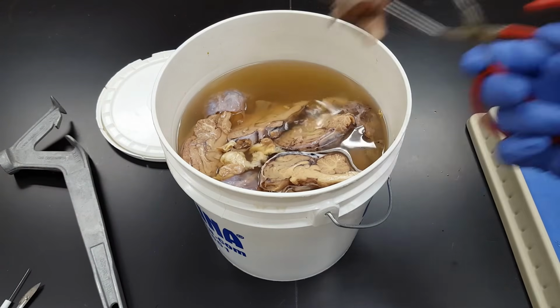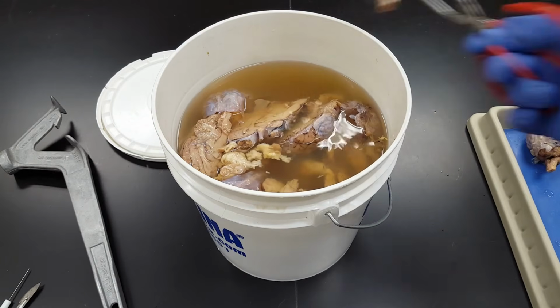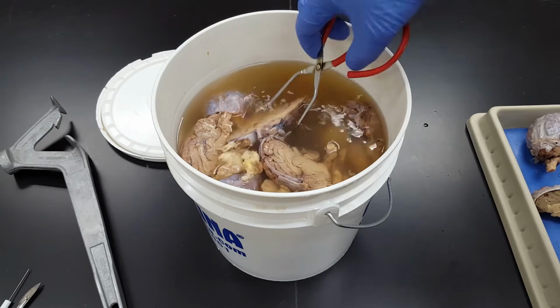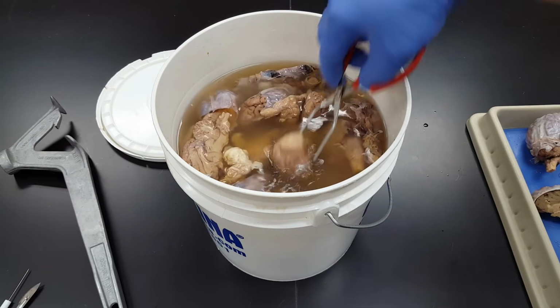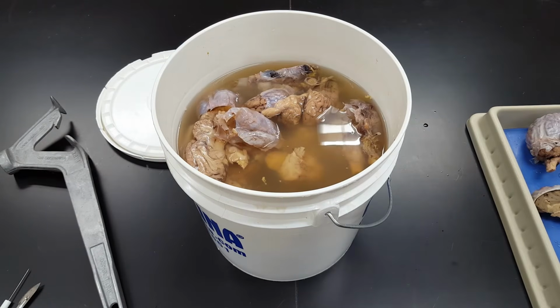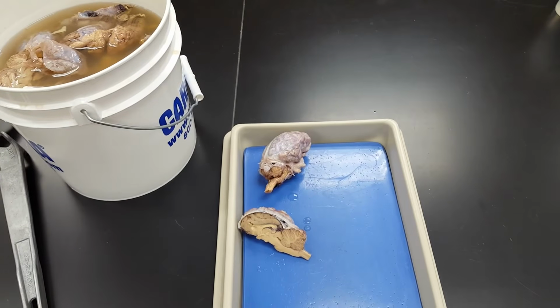So I'm going to take this one out of the preservative, and I'll take this one right here. Nothing wrong with that one. Maybe I'll look for one more decent brain if I can spot one. Ooh, that's pretty mangled. Sometimes I don't make it too well after people work on their dissections. Let's stick with these two for now. And I can't speak for you people, but I can say for myself, I love cutting up some dead stuff.